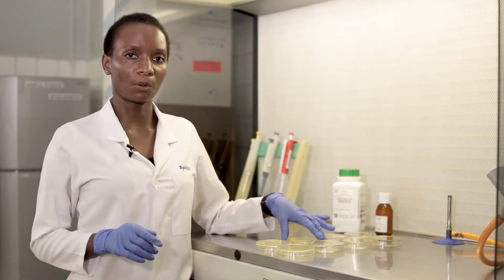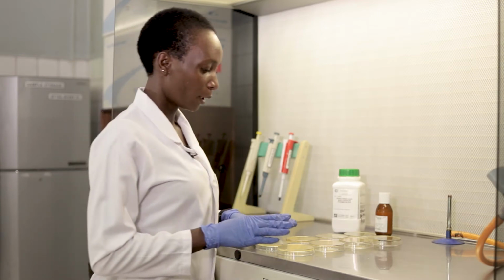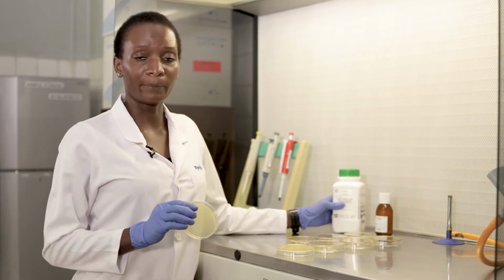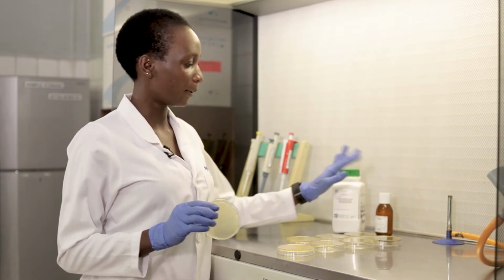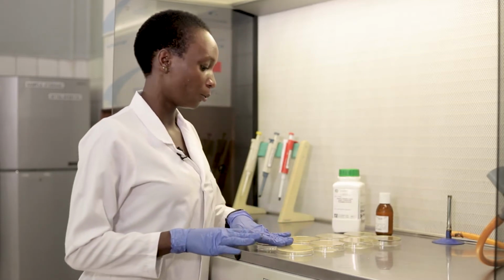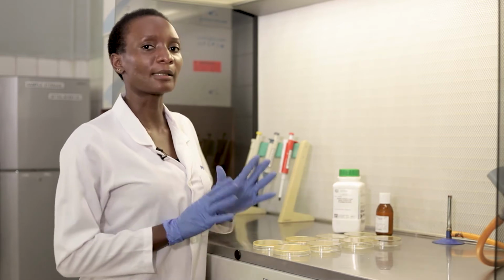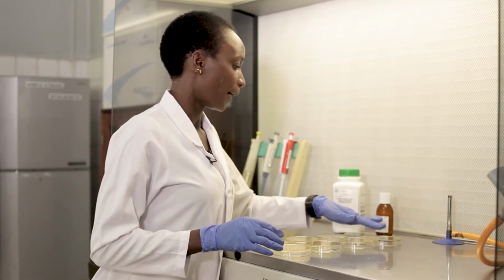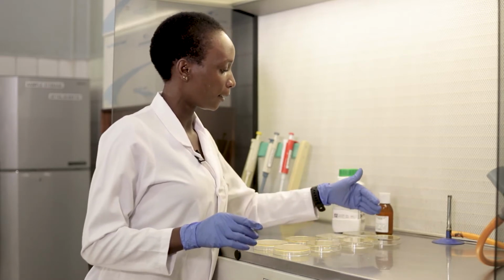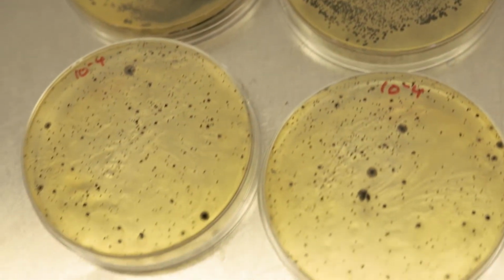In that technique, you recall that we use pre-poured agar plates. So you will already have plates of what I'm now going to call BPA. BPA is Baird-Parker agar. Remember, it's supplemented with tellurite egg yolk emulsion. So in that technique, you will remember that we analyze at least 3 dilutions from the serial dilutions, and we plate them, okay? So in this case, we have the -2, the -4, -6, and -8 dilutions.